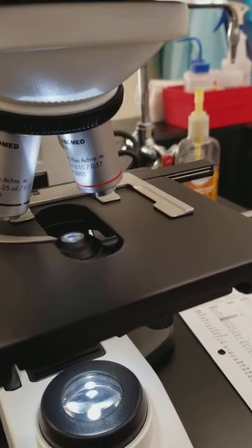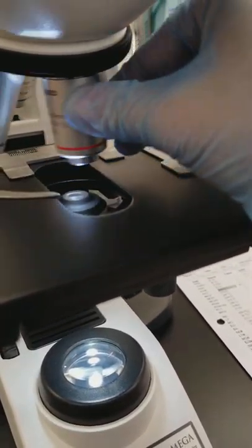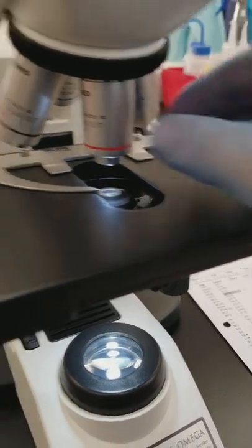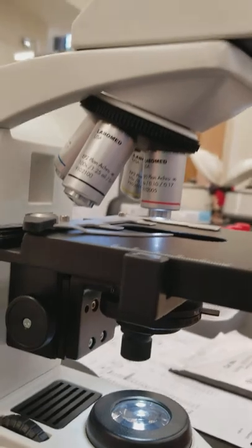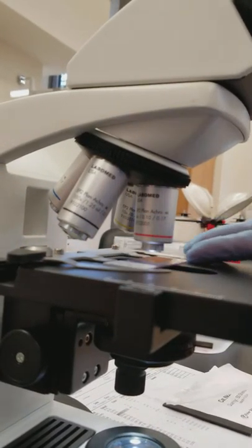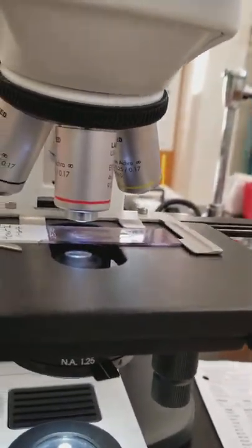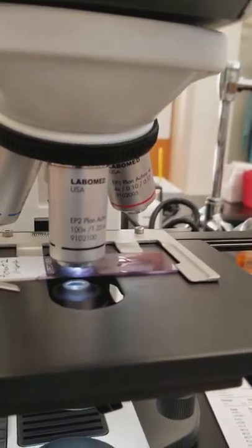So even if you accidentally moved this through, it wouldn't touch the slide. Let me show you what I mean. If I had the slides still on there, you see how it's nowhere near touching the slide. I had it on oil, which is touching the slide.